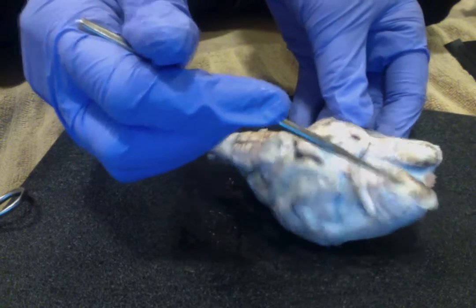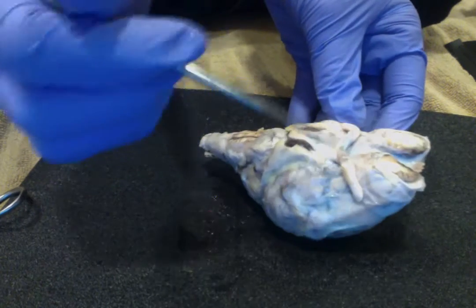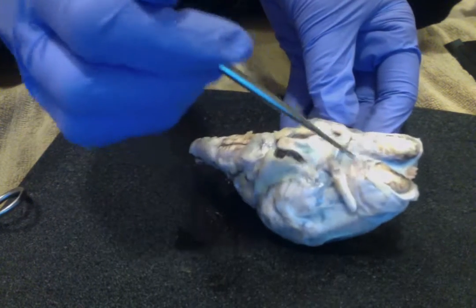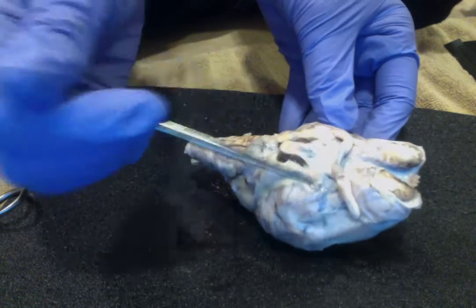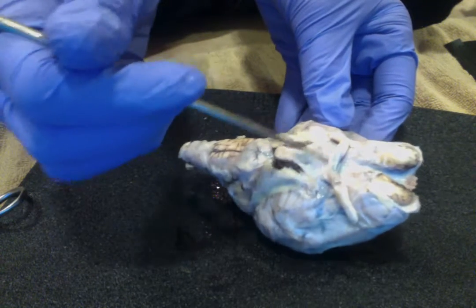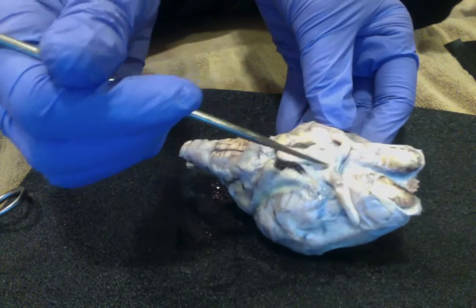This right here is what's going to be the optic nerve, right in here. The optic tract is right in here.